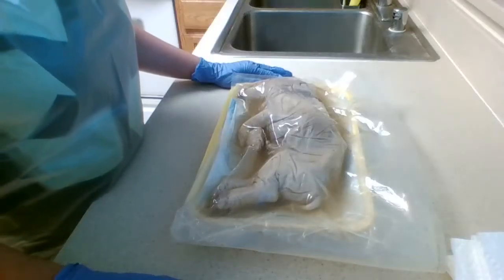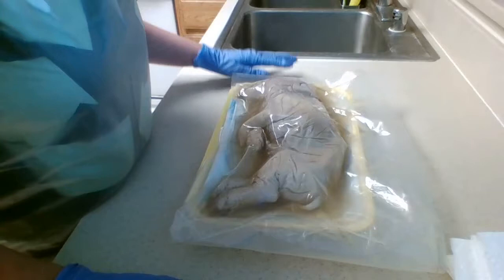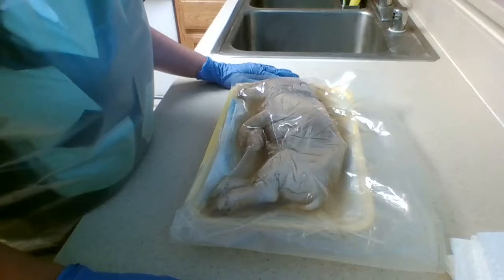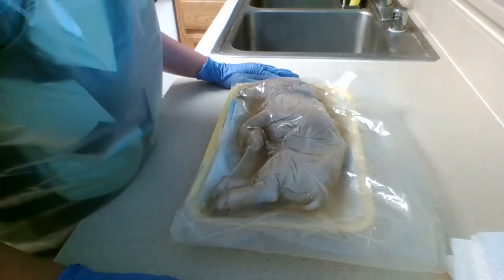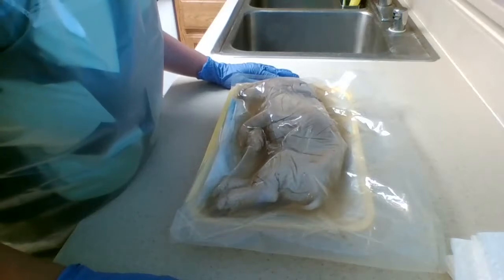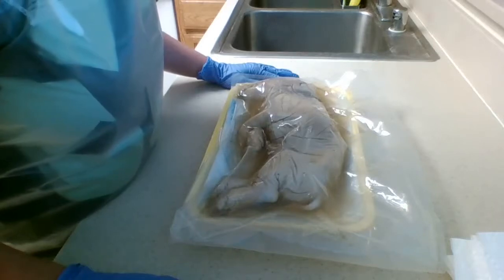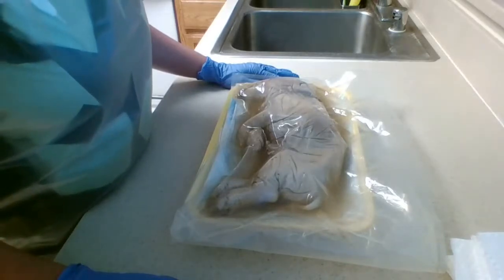So I opened up the kit and I have the specimen in front of me, and step 1 says to read the following information. The internal organization of fetal pigs is typical of most mammals, including humans. The majority of structures you will be asked to identify are equivalent structures in your own body. Pay close attention to the spatial relationships of organs and other structures you reveal throughout dissection. Realize that their positions in the body are not random but are rather associated with other organs as organ systems. Identify each structure and determine its general function.